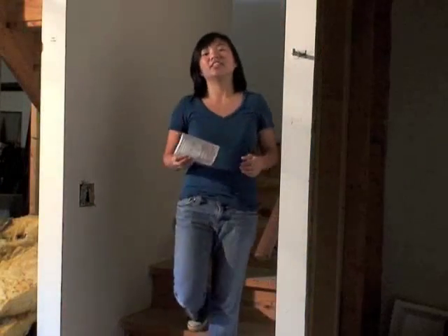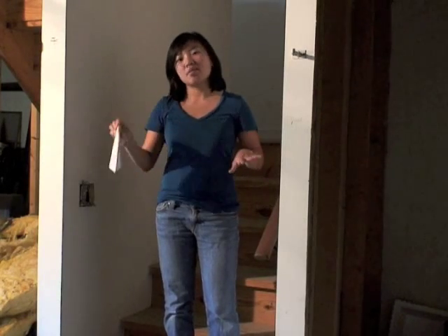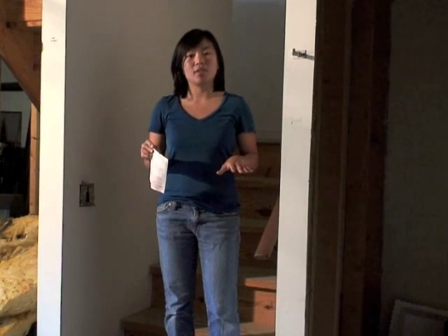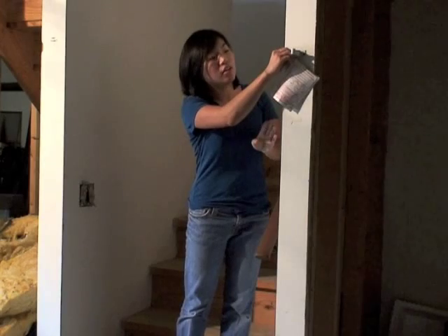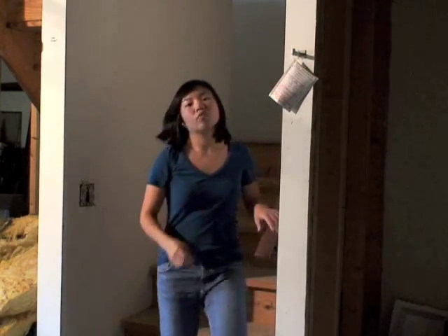For your fourth air test, you want to hang it in the lowest livable level. In this house, it's an unfinished basement, which the owner plans to finish eventually. These steps come down in the center of the basement, so we're just going to hang it right here, where it's centrally located, for 48 hours.